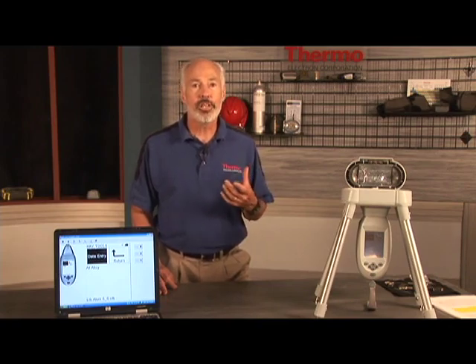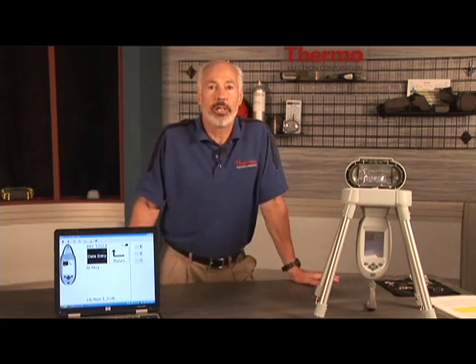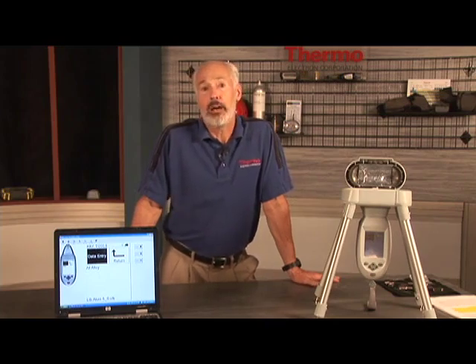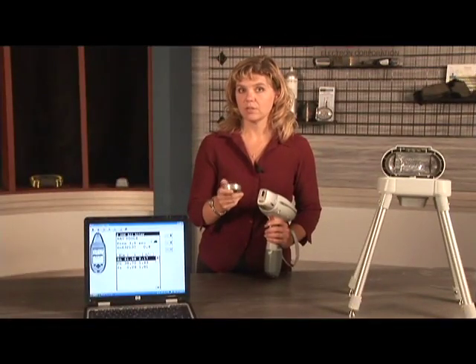If we are interested in screening for restricted substances in solders or metal alloys used with electronic parts, we can leave the instrument in the alloy mode. Solders can then be measured like any other alloy. Here is a typical tin lead solder called 6337.